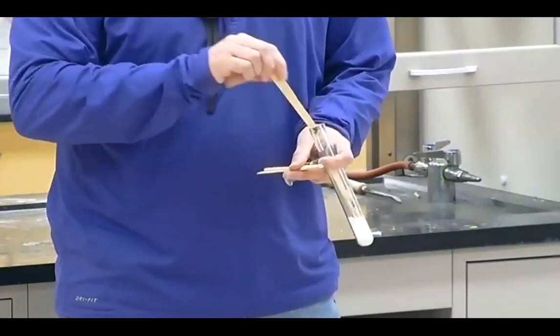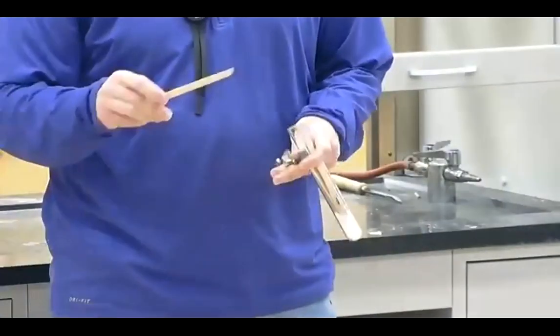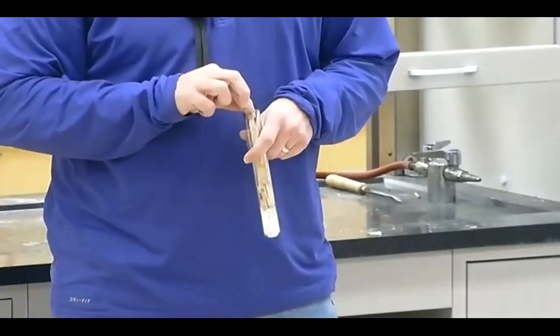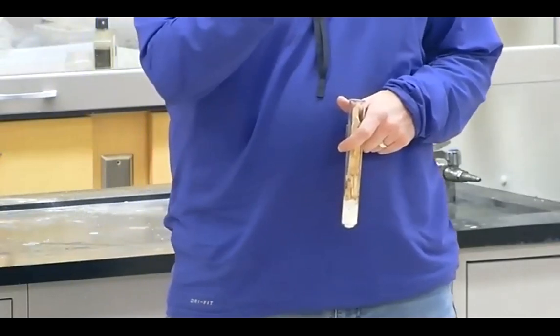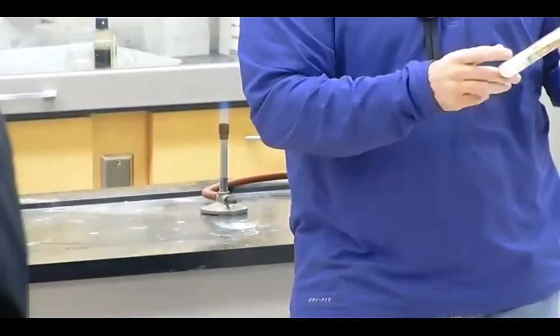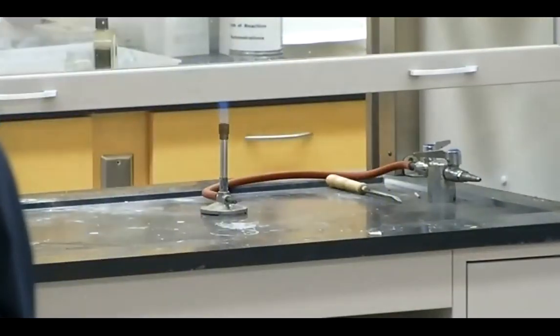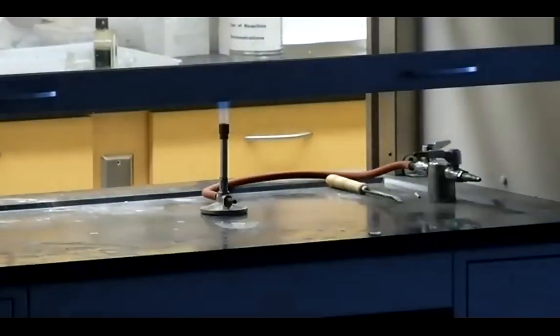Now, at first it's kind of boring because I'm just having to melt the white powder before it will actually start to decompose and produce the oxygen. So just for a bit, I'm just going to heat it, and you'll be bored, but eventually it gets going pretty cool. Sound all right? Okay, good. Go ahead. Yep.